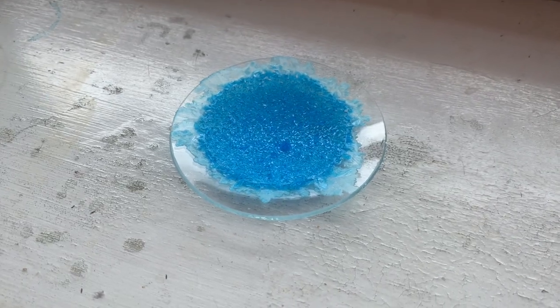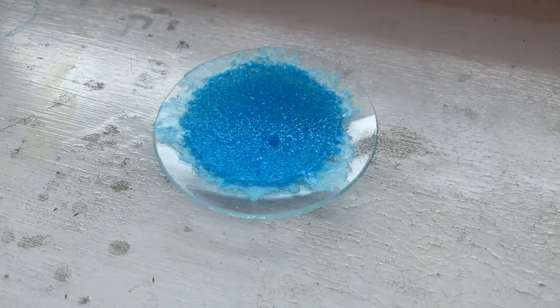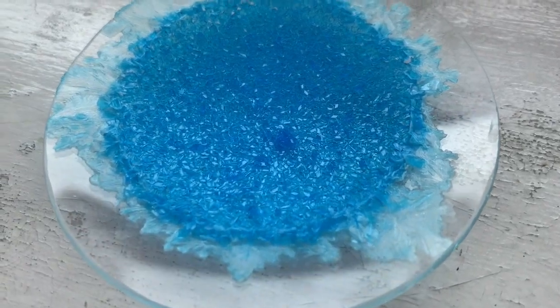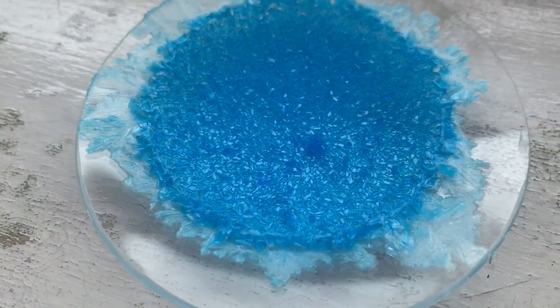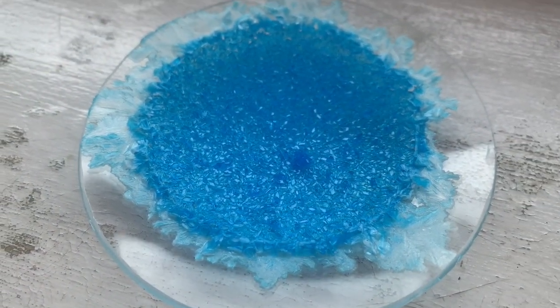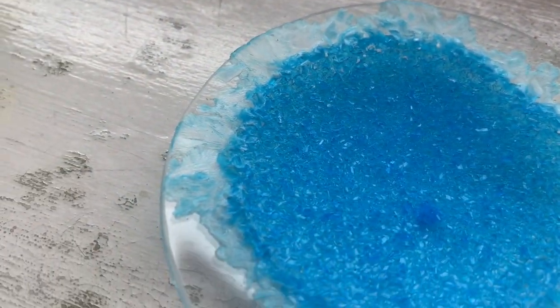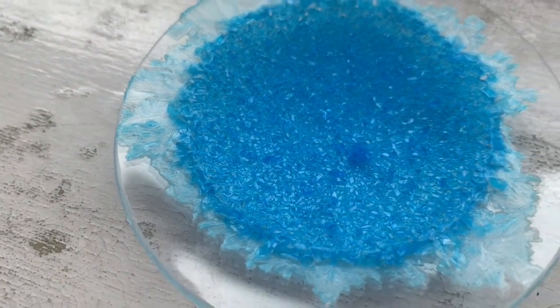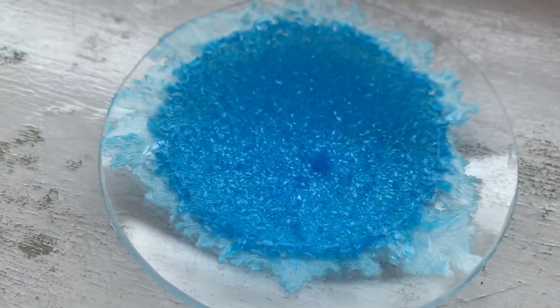I have come back over the weekend and you can see here that my dry crystals of copper sulfate have all now been created. You can see they've made a really nice shape and they're really bright blue and very, very sparkly.